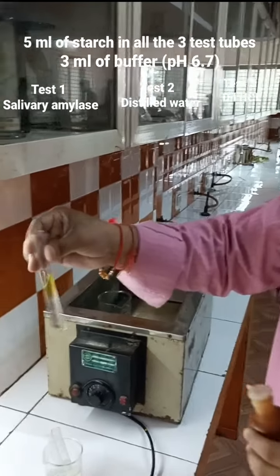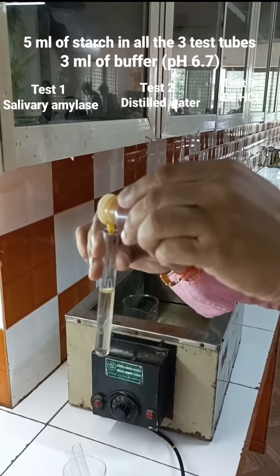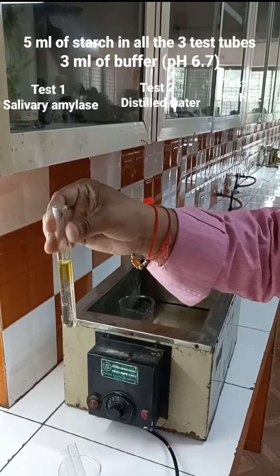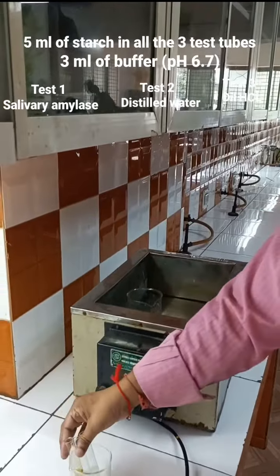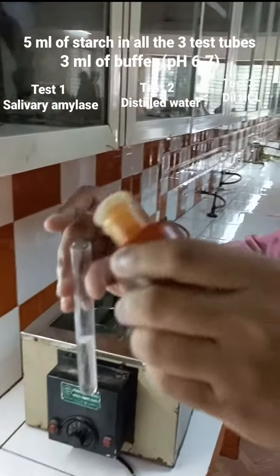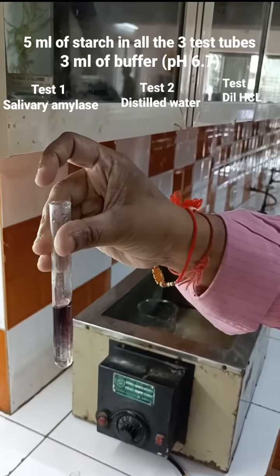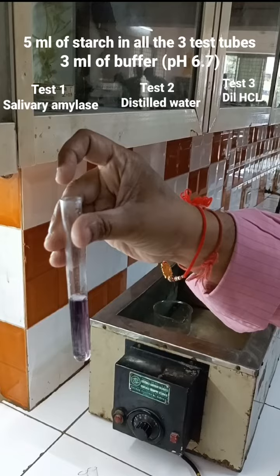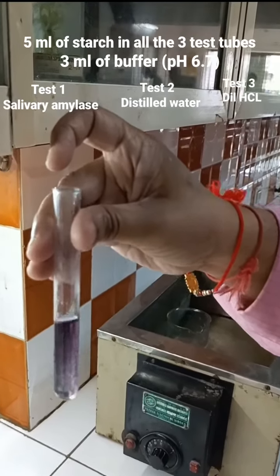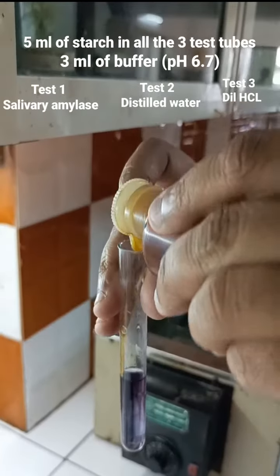You will not get blue color because salivary amylase has broken down starch into disaccharide. So no starch, no reaction with iodine and no blue color. In test tube number 2, you add iodine. You get blue color because starch is already present. It reacts with iodine to form blue color, that is polyiodide. So you can see the blue color.